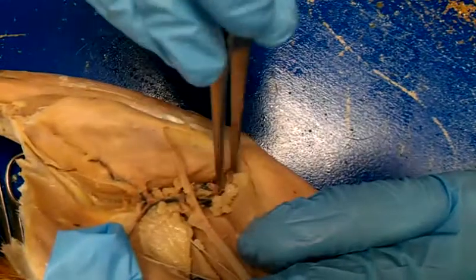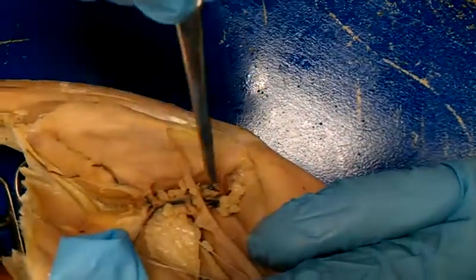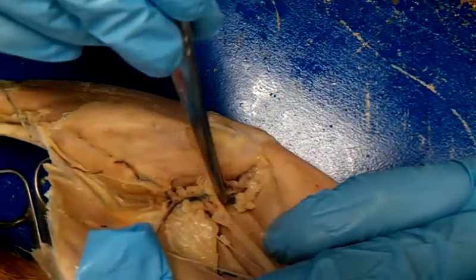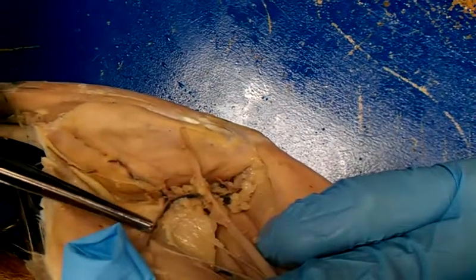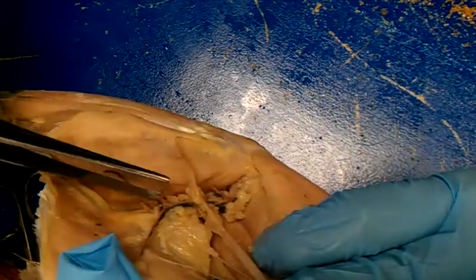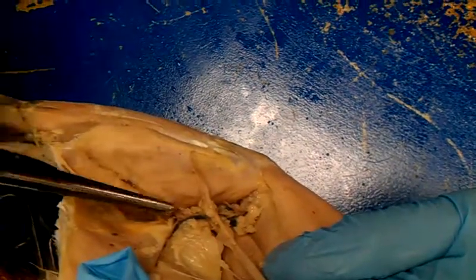Underneath the knee is going to be the popliteal, like the popliteal surface, and then we think it arches out over here, and this is going to be the posterior tibial, and this is going to be the anterior tibial. Is that it? And we did everything. That's it.